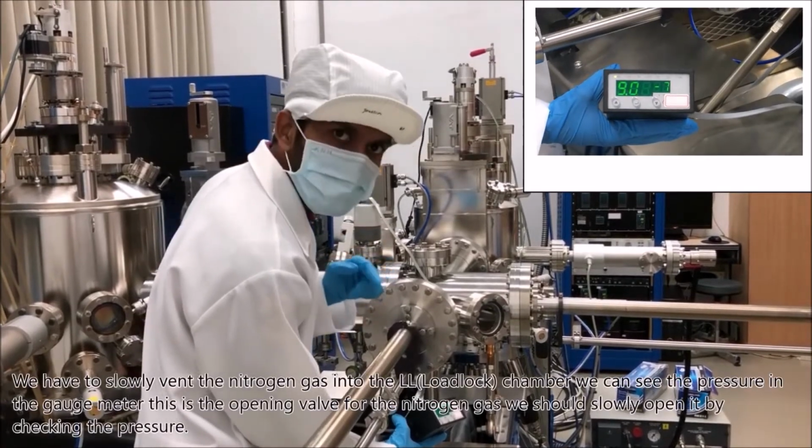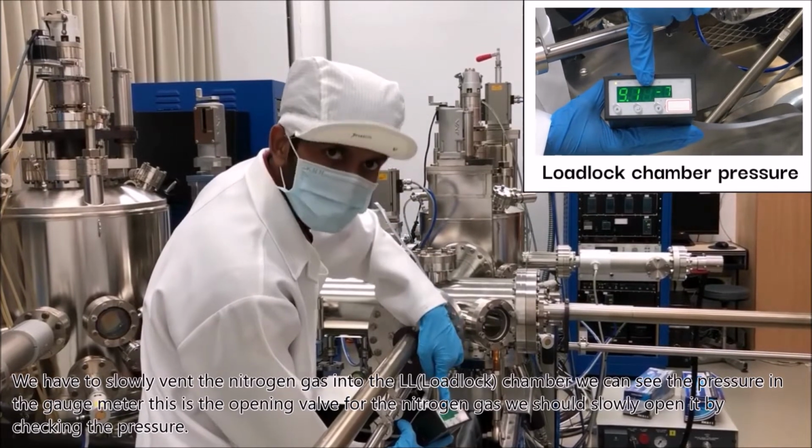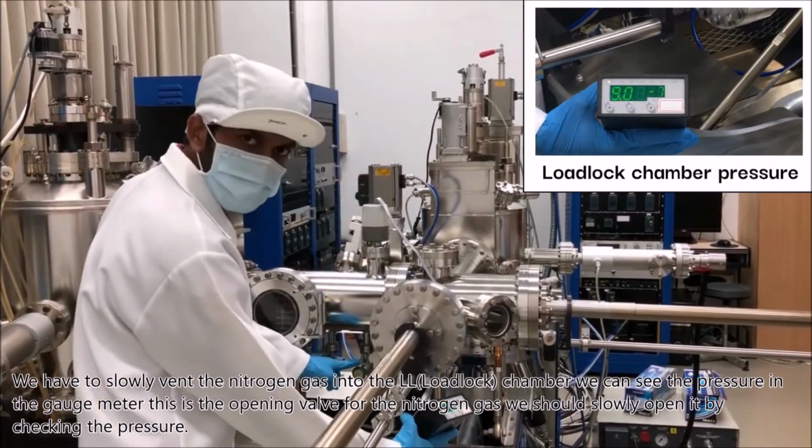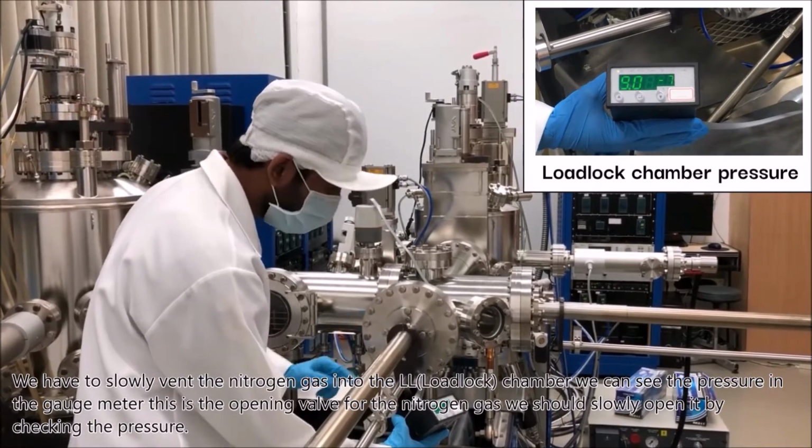We have to slowly vent the nitrogen gas into the LL chamber. We can see the pressure in the gauge meter. This is the opening valve for the nitrogen gas. We should slowly open it by checking the pressure.